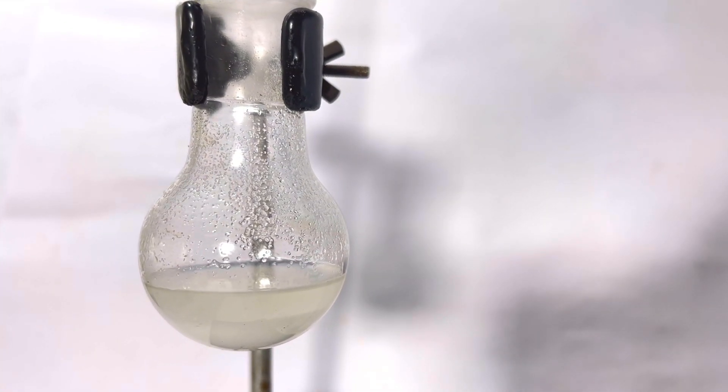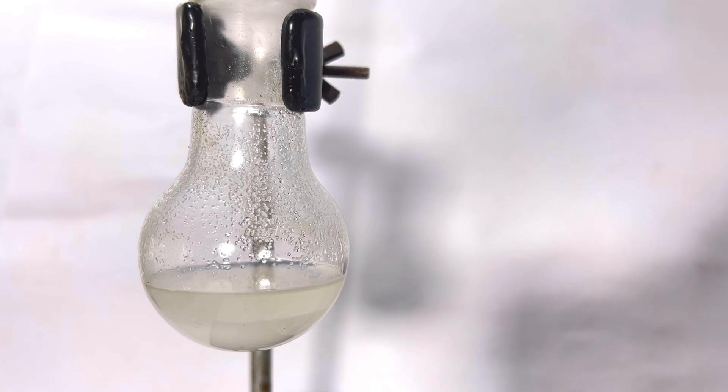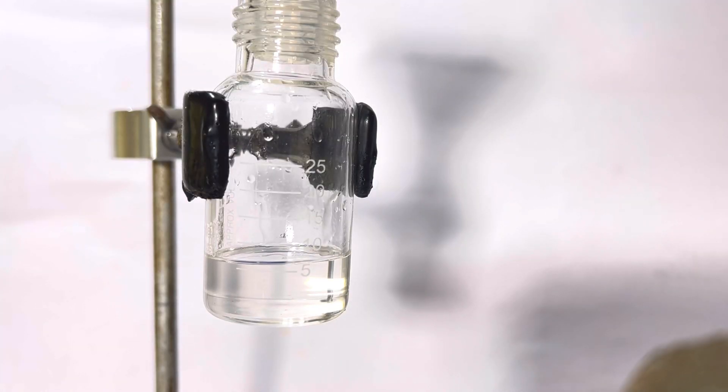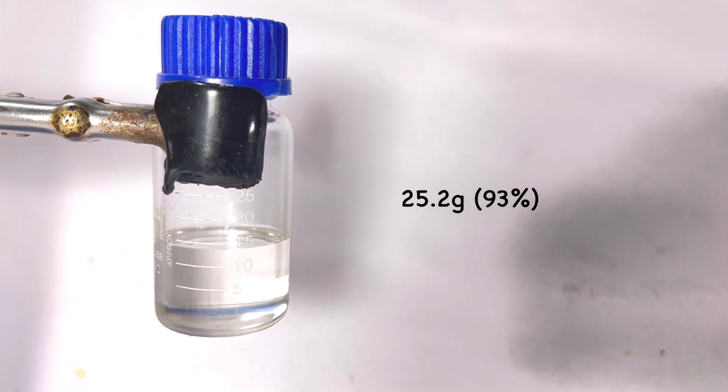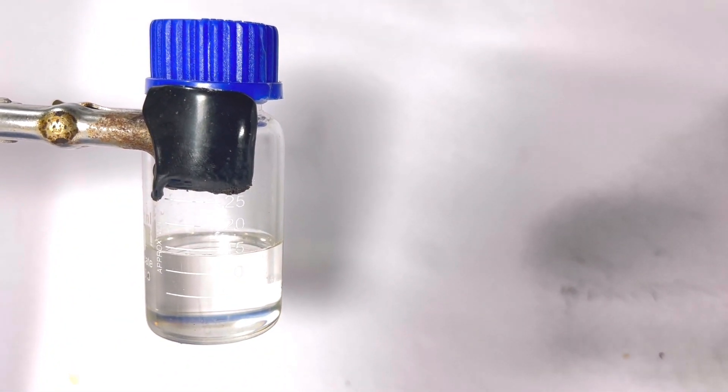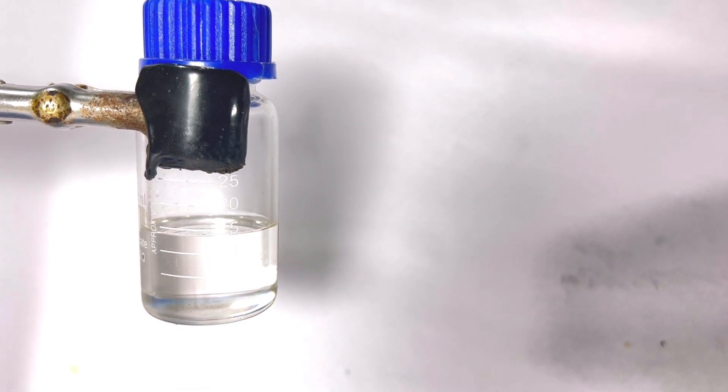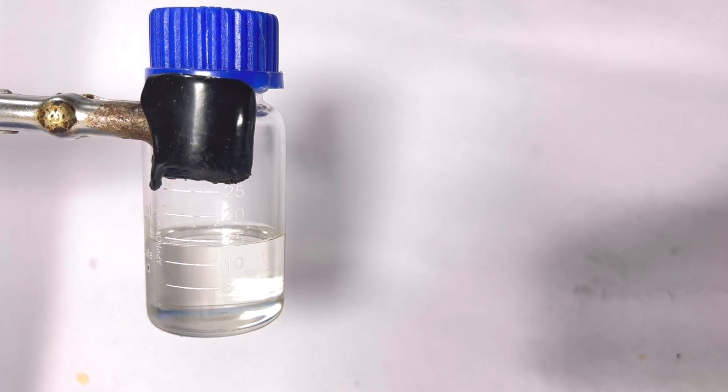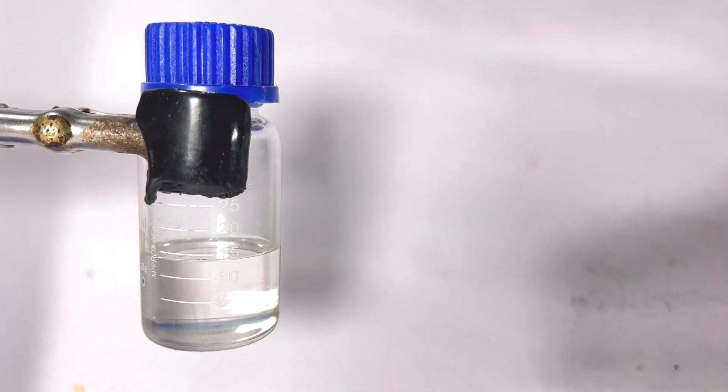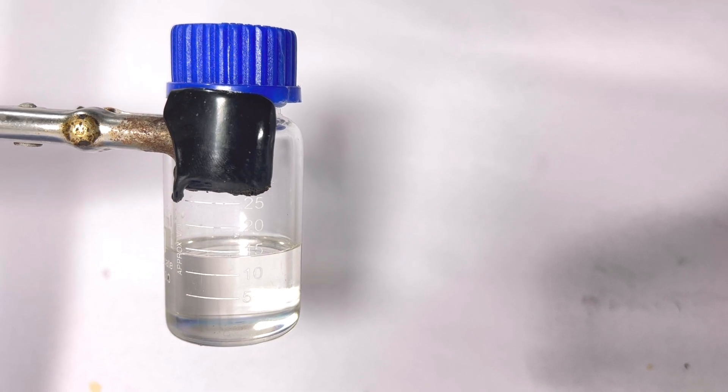The final volume that I collected was approximately 14ml which is around 25.2 grams. This represents a 93% yield which is much higher than the yield which is recorded in Vogel's textbook which is only 74%. This might be probably because the time taken for reflux in Vogel's is only 3 hours and I had refluxed the solution for about 5 hours which means 2 hours extra was done by me.